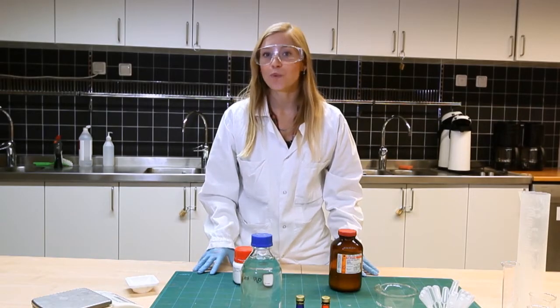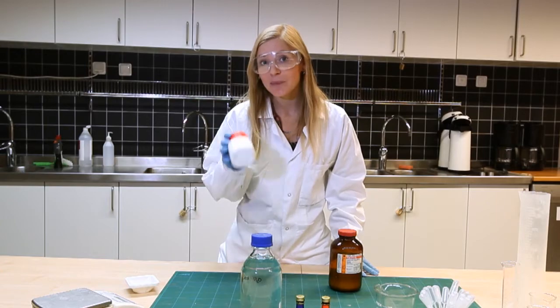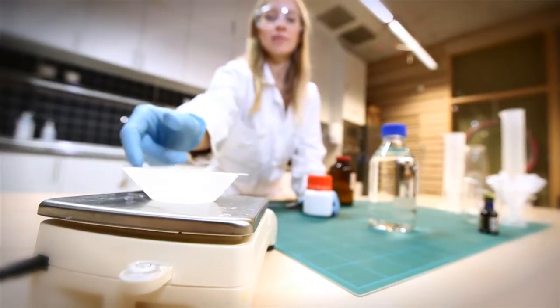Today I'm going to make a solution that is 100 milliliters, and that means I'm going to add 2 grams of sodium alginate.